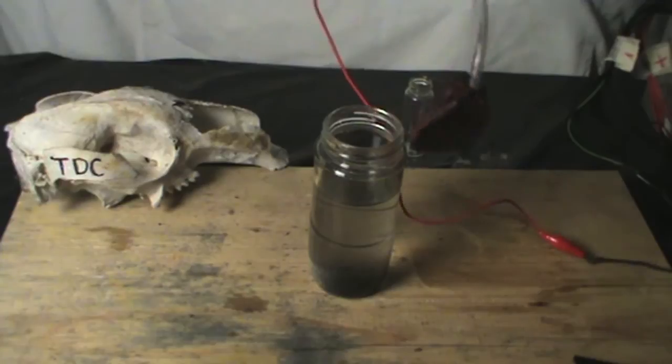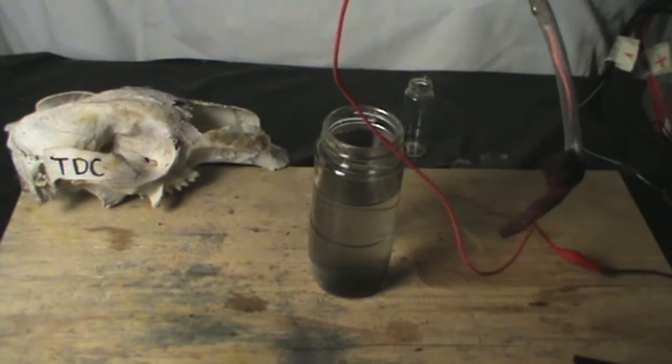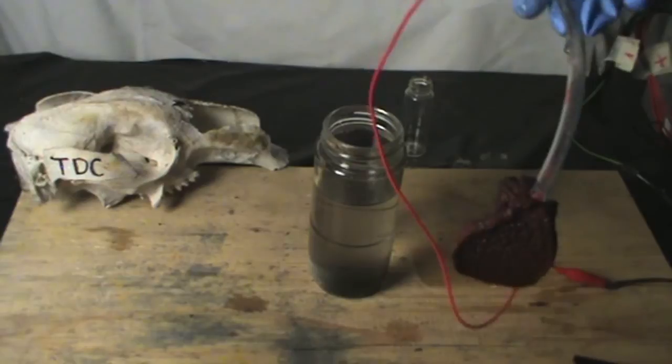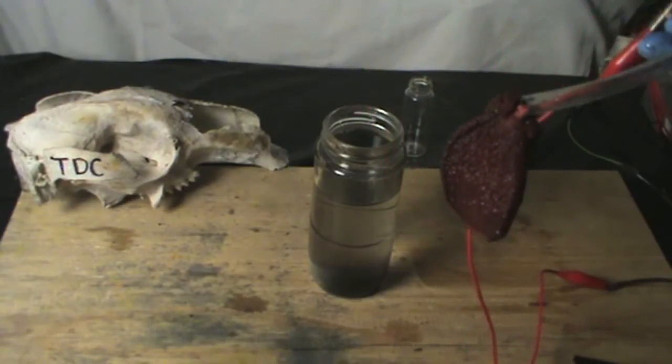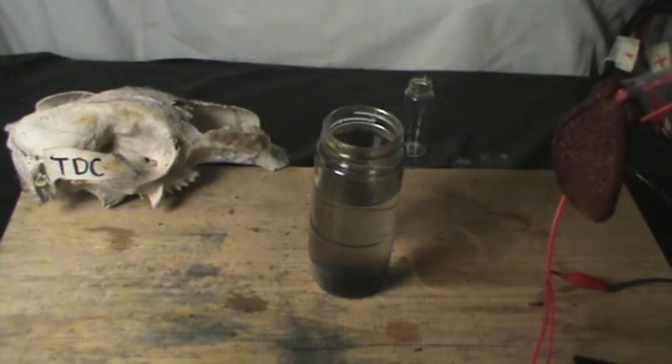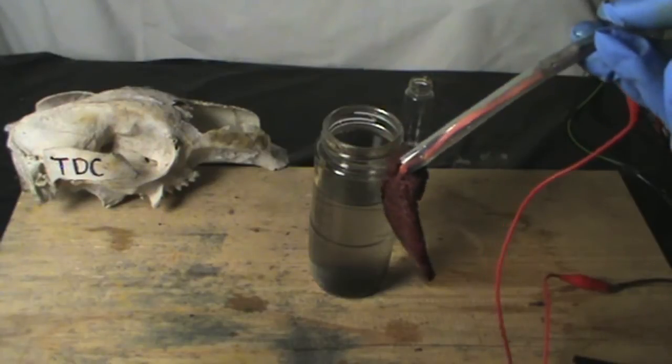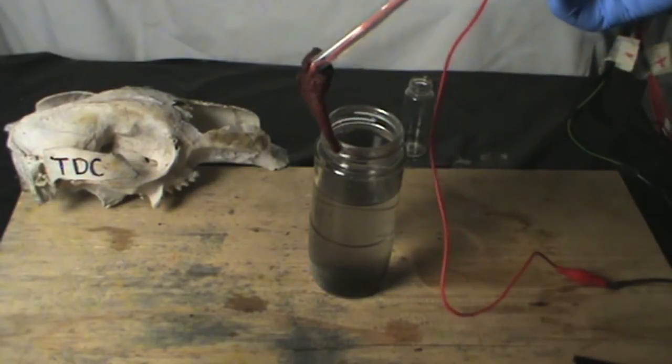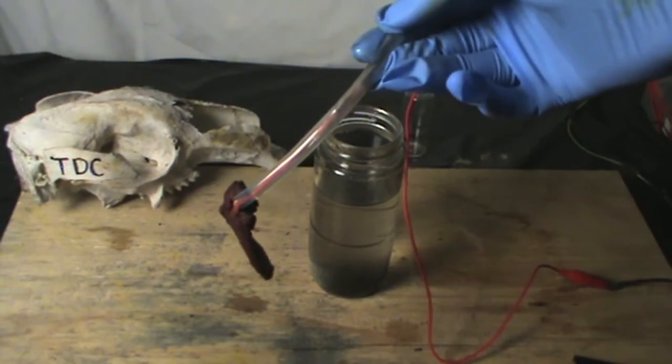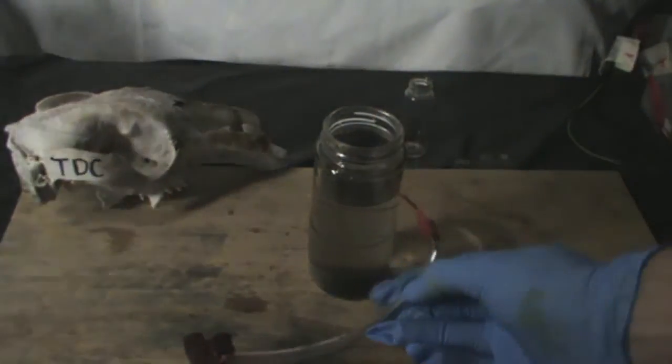Note, if we were using a carbon electrode, the solution wouldn't have been clear but filled with particles of carbon. We can successfully conclude that lead dioxide electrodes are efficient and durable for this process.